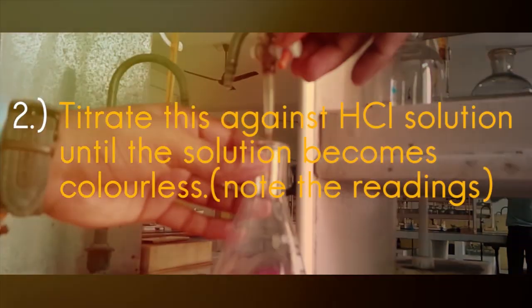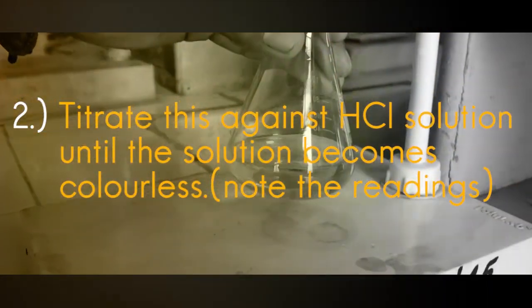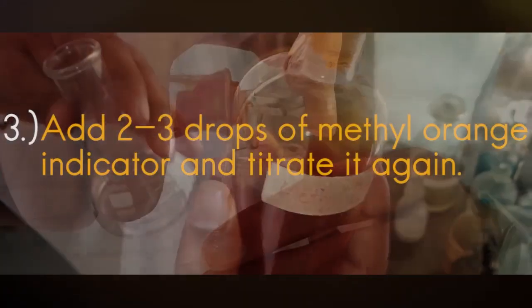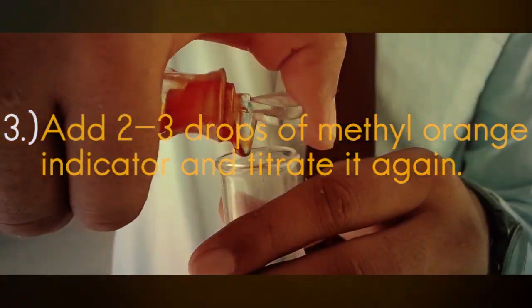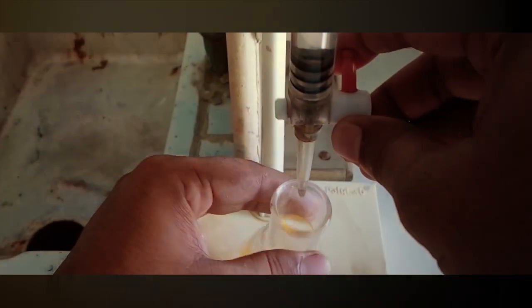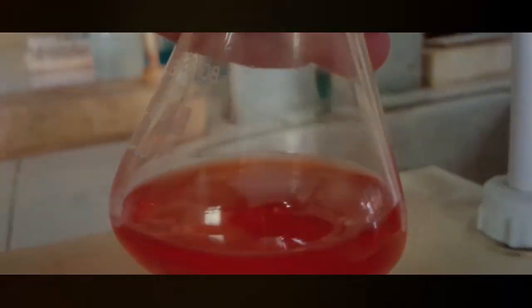2. Titrate this against HCl solution until the solution becomes colorless, and note the readings. 3. Add 2-3 drops of methyl orange indicator into the flask and titrate it again. 4. Stop when you see red color and note down the reading. That's it.